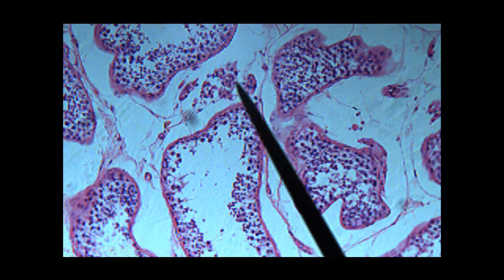These cells between the seminiferous tubules are called the cells of Leydig, or interstitial cells. They produce testosterone. So basically, as long as they're functioning, men have all the characteristics. No testosterone, no male characteristics, and a man would be sterile, can't produce sperm. So seminiferous tubule, that little wad of cells, it looks like maybe a little artery, but that little wad of cells is called the interstitial cells.